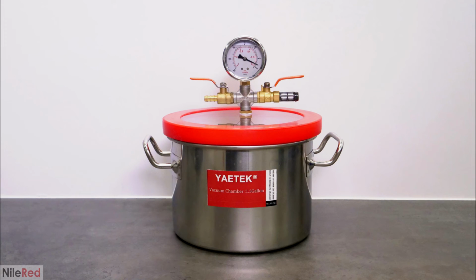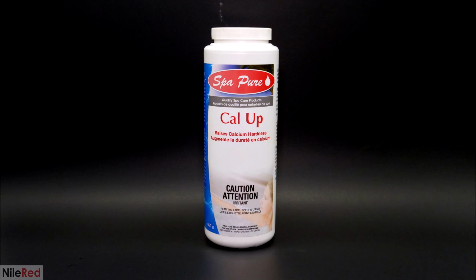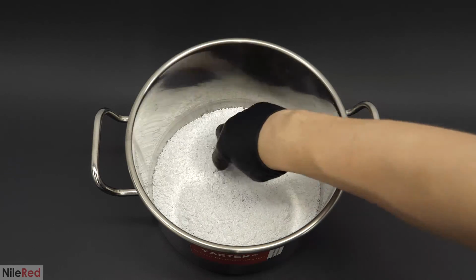It was really important to get them completely dry though, and to do this, I used a vacuum chamber. This was the chamber that I used, and I got it from Amazon for around $100. The pump that I used was also from Amazon, and I got it a while ago when I was working on my transparent wood project. Along with this, it was also important to get some calcium chloride drying agent, and I picked some up from Home Depot.